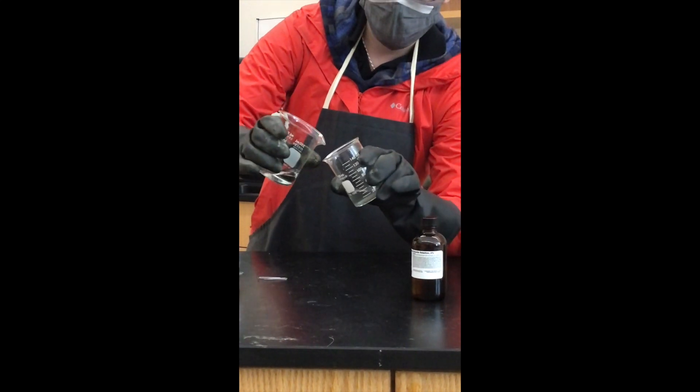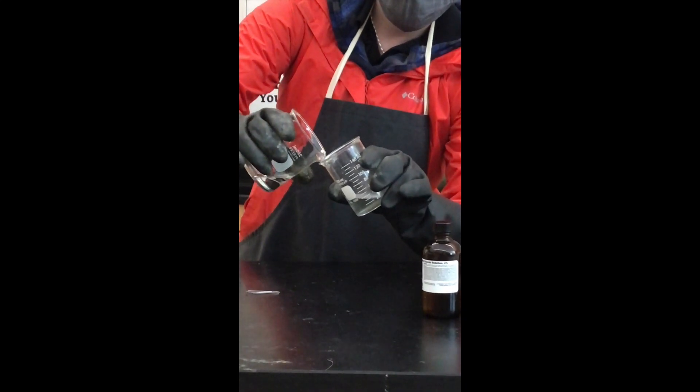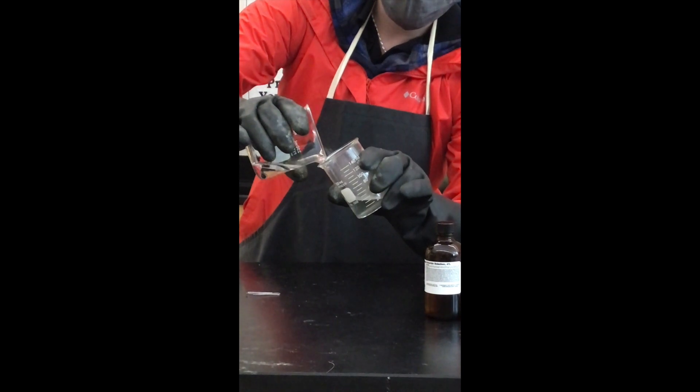I'm going to tilt my beaker sideways. I'm going to pour very slowly down the side of the container.